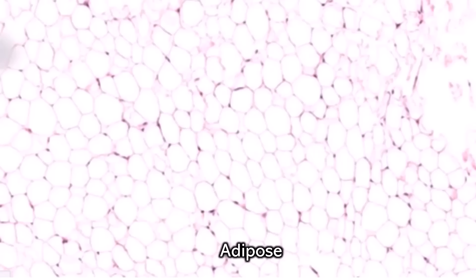When you see all these very thin little bubbles, you're looking at adipose.